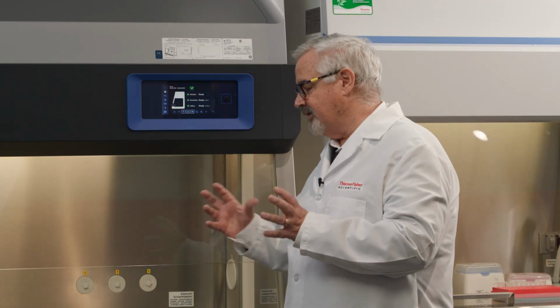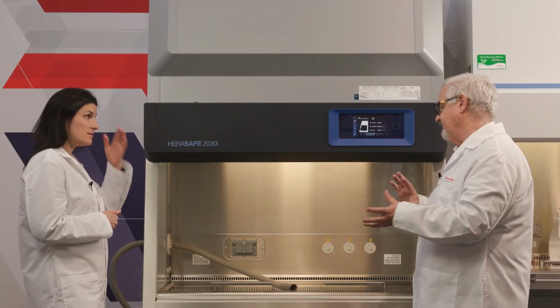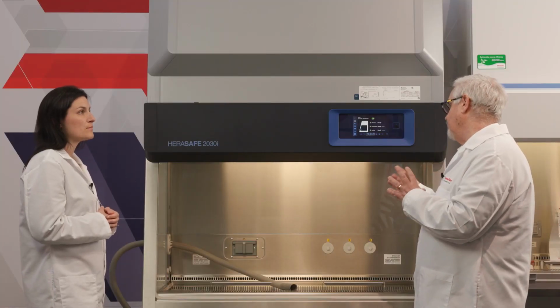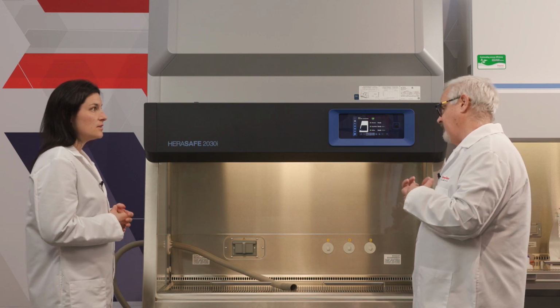It was really interesting what we discussed last time when we talked about the particle counter. So it got me to thinking, what can we do with a smoke machine? As you know, I really love the particle counter, but the thing it doesn't really show you is air. So with the smoke machine, we're going to get a closer look at the air barrier and the interaction of airflows that create the air barrier.